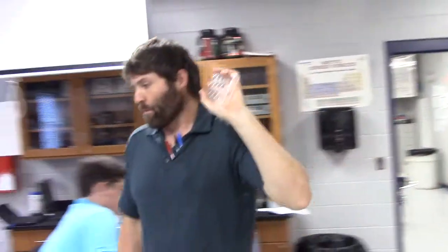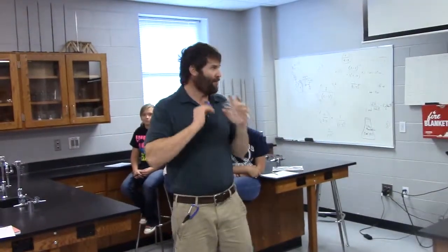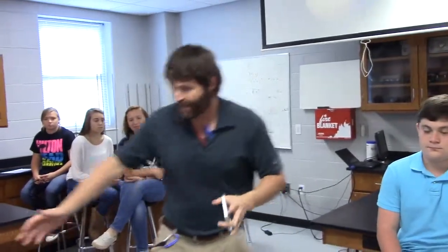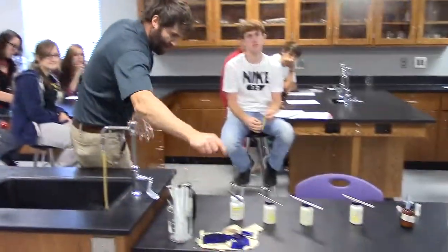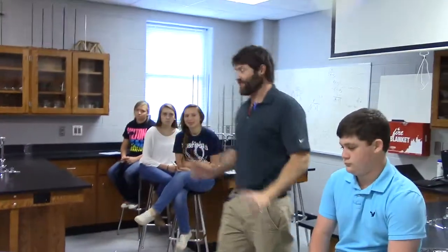Alright, so what is the purpose of this lab, a flame test lab? Every chemical gives off a certain unique color flame. And so what I've got, and I want you to look at what I've got laid out up here in front of you. I've got seven different containers of chemicals laid out here. Every one of these chemicals will burn and give off its own distinct color.